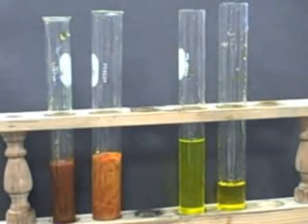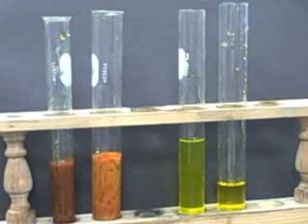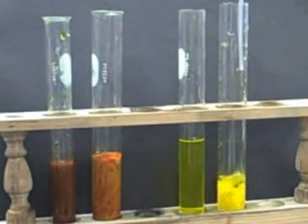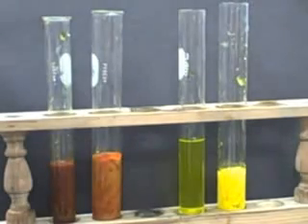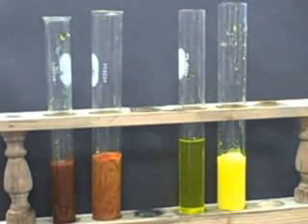Actually, I think, no, there's no nickel chromate precipitate. Nickel chromate's probably been made, but it's probably soluble. So that one actually didn't work. And now we're going to do lead chromate. A yellowish color. The yellow is probably just from the chromate, but it is still a yellowish color. So that's lead chromate. So those are chromates.